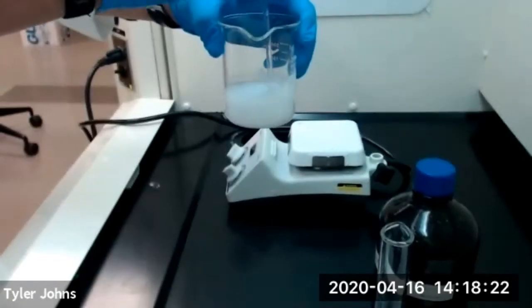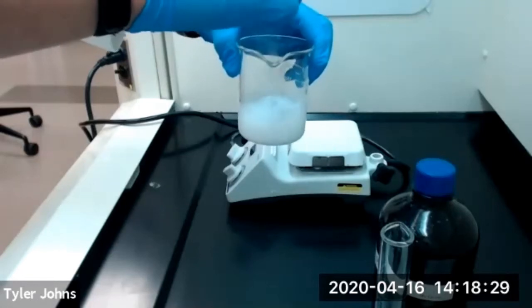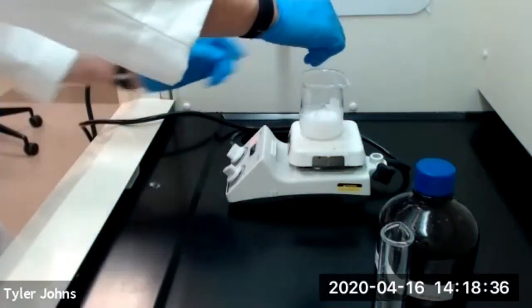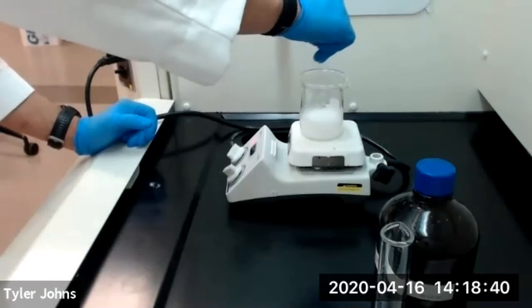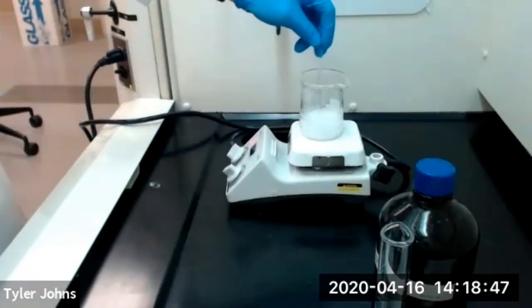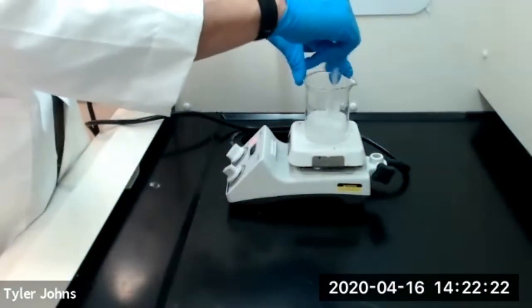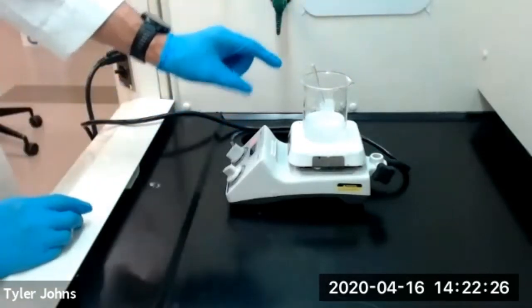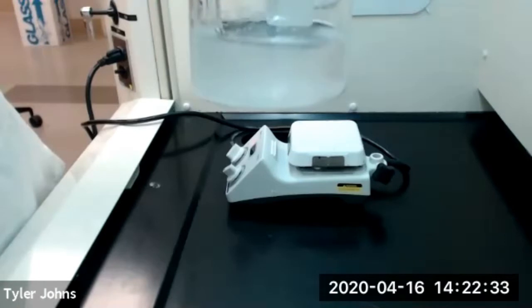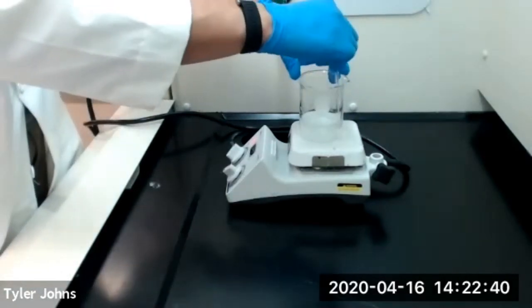What we're going to do next is we're going to gently heat our beaker until we reduce our volume to about 45 milliliters. I'm going to put this on the hot plate and continue to stir. We're continuing to heat and reduce our total volume down to about 45 milliliters. Most of our aluminum hydroxide lumps have now dissolved and our solution is turning clear. We'll continue heating this gently and reducing the volume.